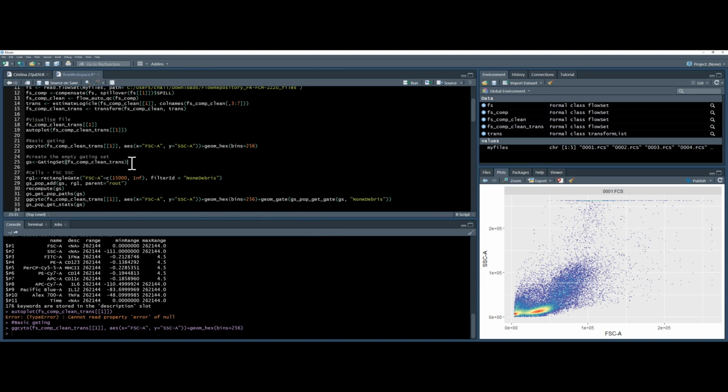So first, I want to create a gating set. flowWorkspace is a package that mimics the gating hierarchy you would normally use to analyze your flow cytometry data, similar to what you would have in Diva or FlowJo, FCS Express. Now, flowCore, the core flow cytometry analysis package, does have something called filters, but using these gating sets in flowWorkspace, you'll recognize the analysis more easily. So first I want to create an empty gating set using the gating set command.